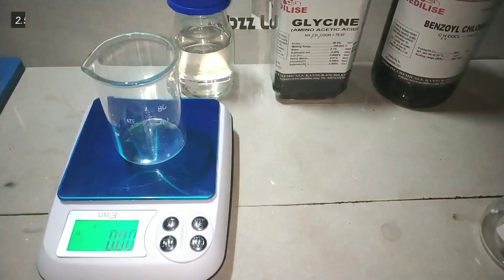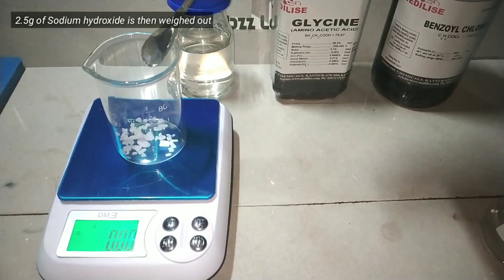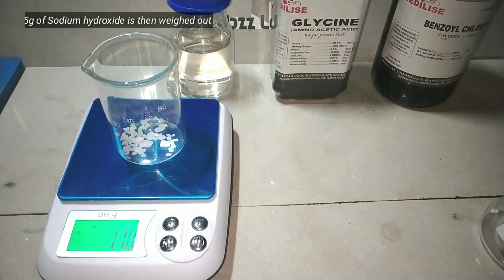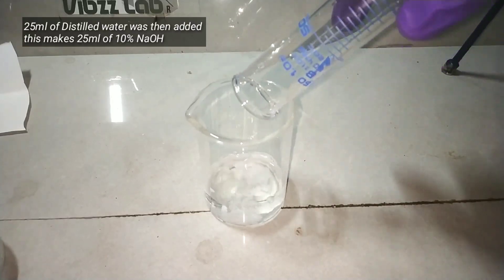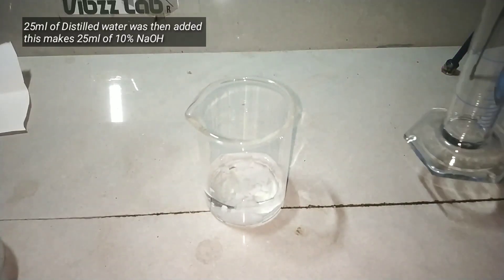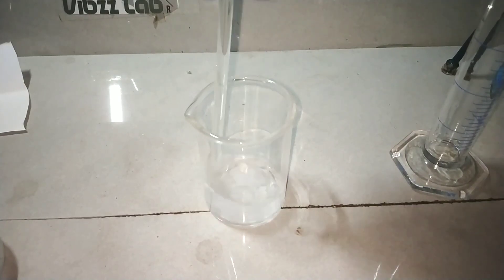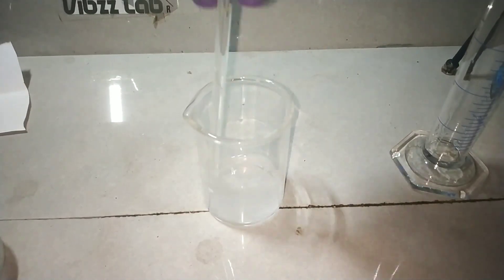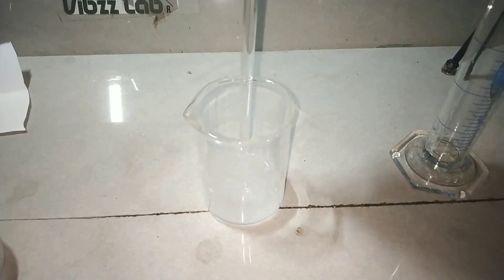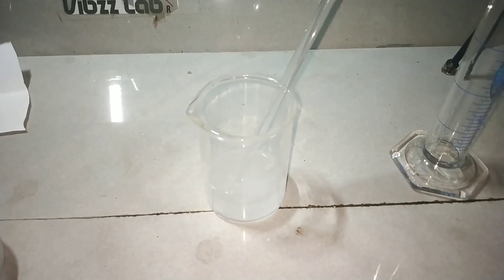Now we weigh out 2.5 grams of sodium hydroxide. We should weigh out the appropriate amount of sodium hydroxide required to make a 10% solution. If you want 100 ml solution, just add 10 grams of sodium hydroxide to 100 ml of water. But here I only want a very few ml, so I decided to scale it down to 25 ml, which means 2.5 grams of sodium hydroxide.